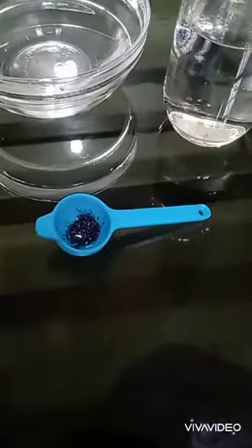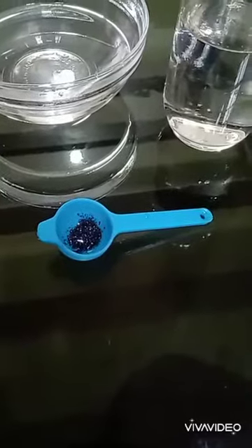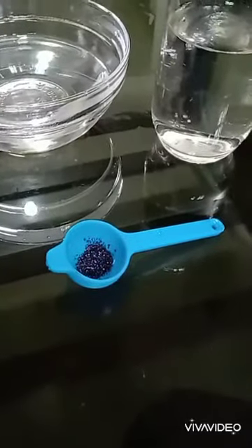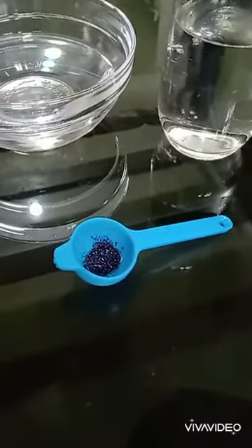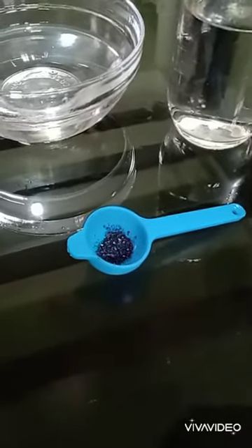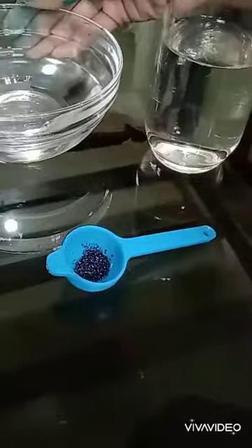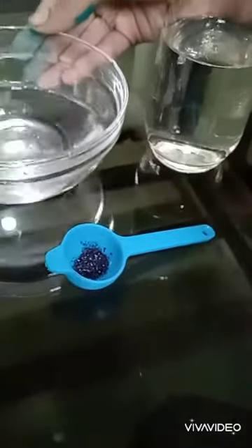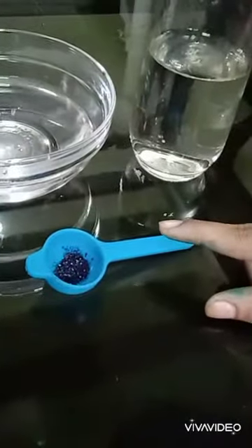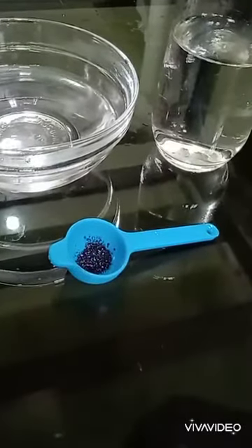Hello, Assalamu Alaikum everyone. I'm here to do an experiment about the discontinuous nature of liquid. To do this experiment, we need a beaker or a glass, some water in a bowl, and potassium permanganate. Now let's move into the experiment.